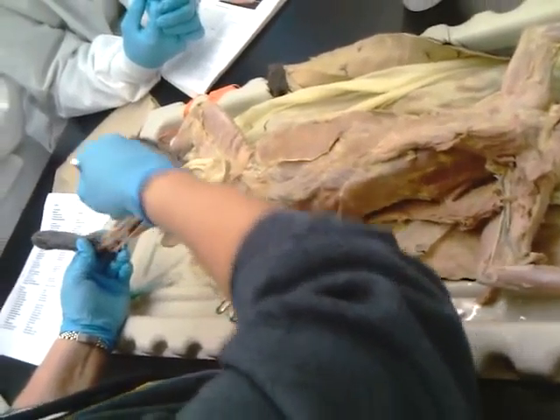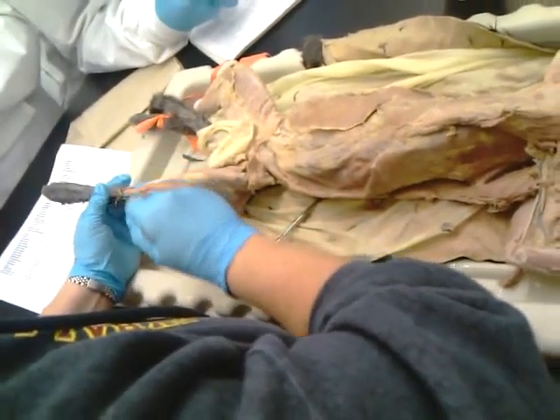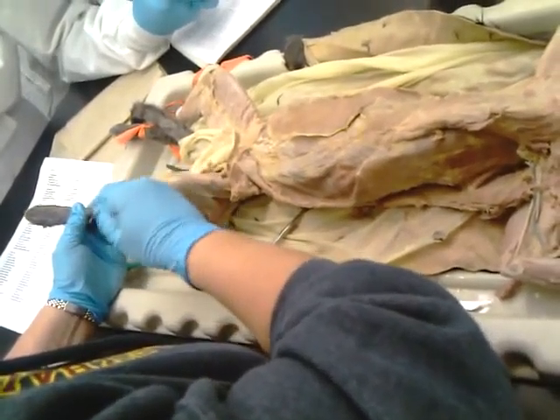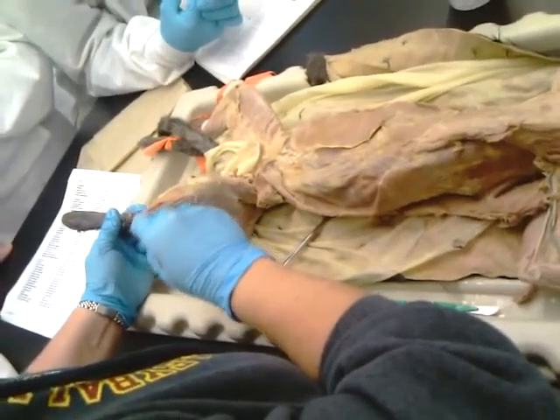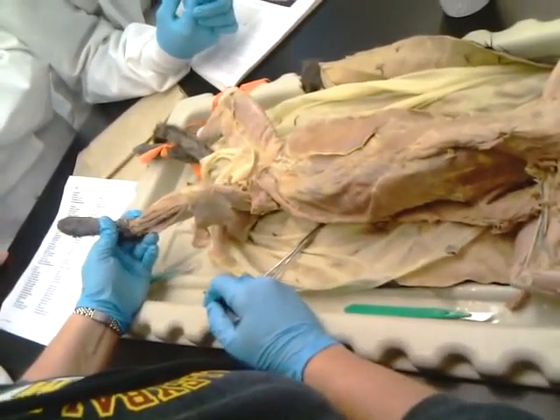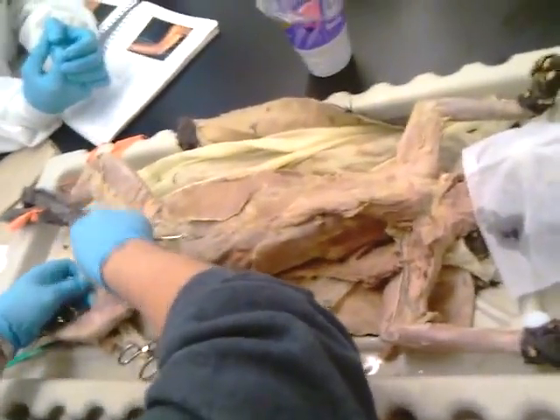And then what's going to be the one that extensor digitorum longus? Okay? So that's why you separate things out, so you can see where they're going. And then you'll have a probe, so you can poke and prod and all that kind of stuff. Okay? Now, if we're here, I'm sorry, I can do this.